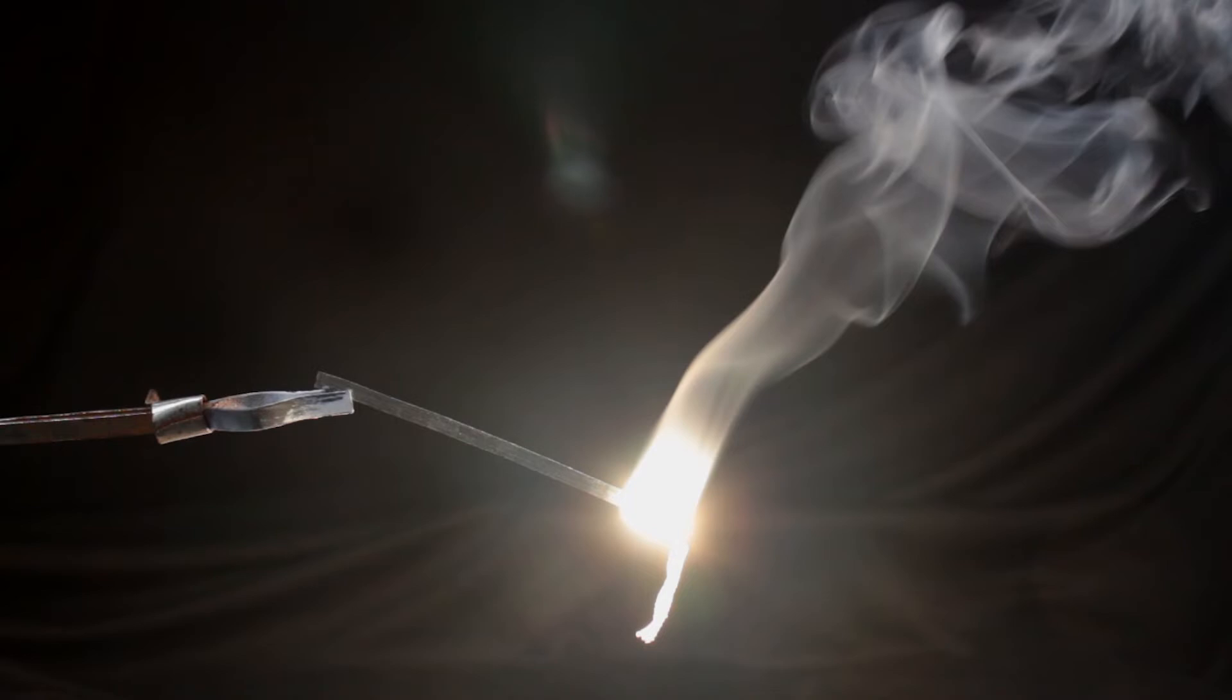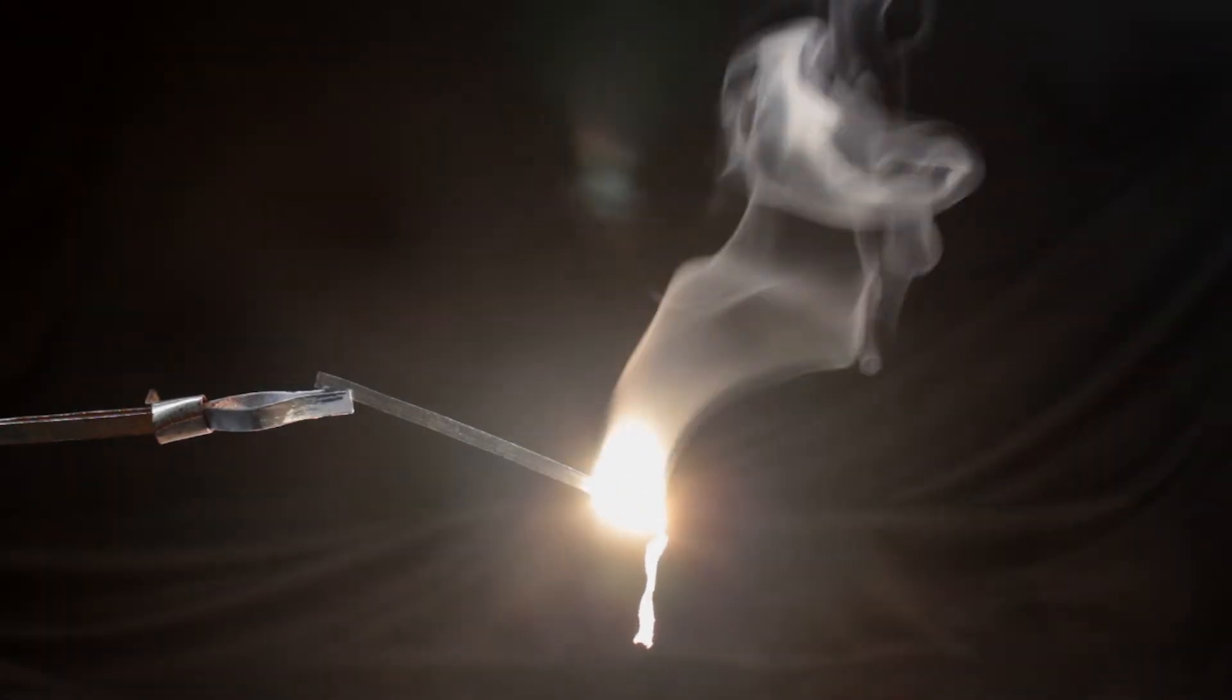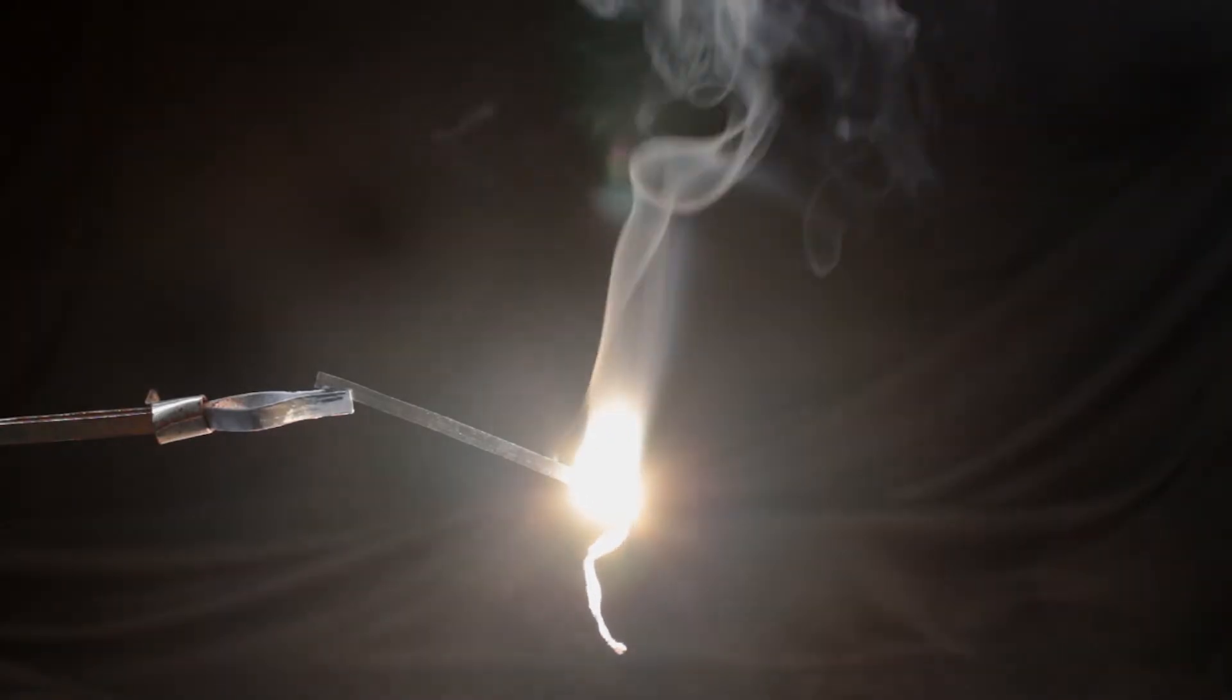What do we see? Blinding white light, white smoke and formation of white solid as a result of burning.